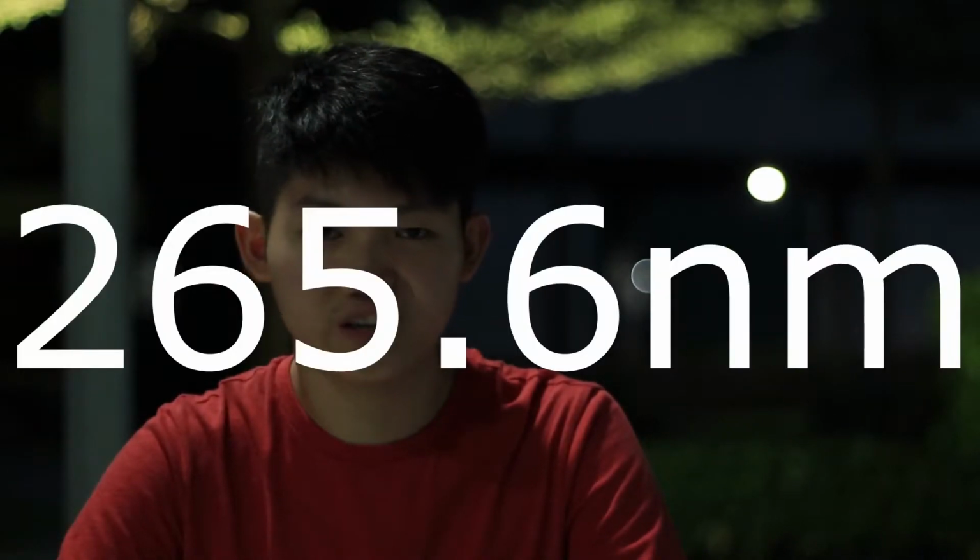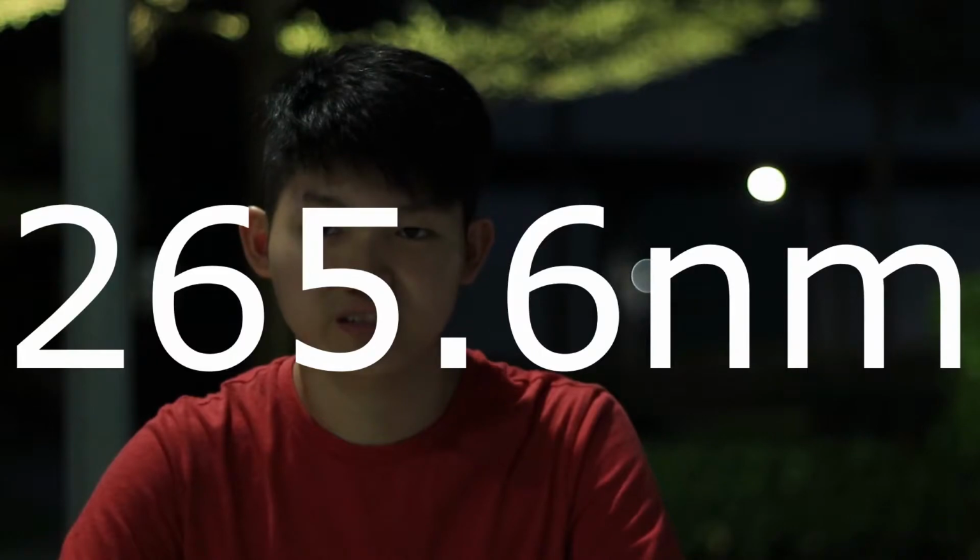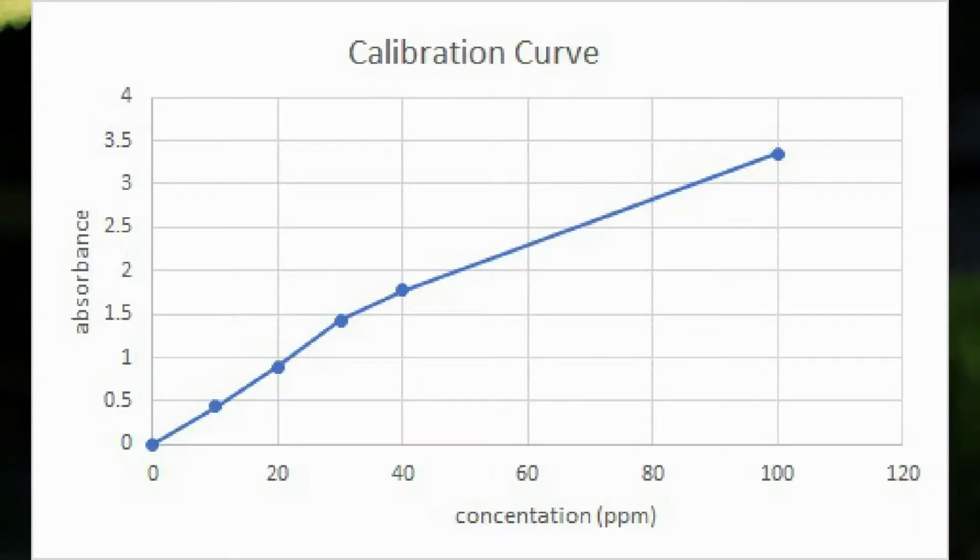Okay, to summarize this experiment, we performed the wavelength scan for caffeine and we got a value of 265.6 nanometers. A calibration graph has also been drawn to illustrate the order of the graph, linearity and the accuracy of the instrument that we use in the UV-based experiment.